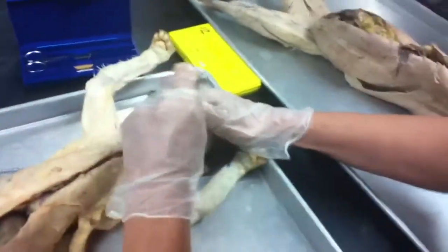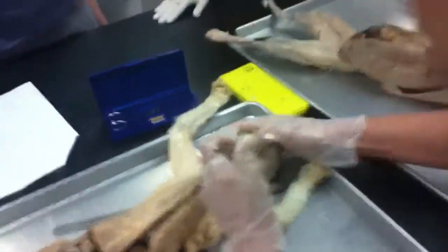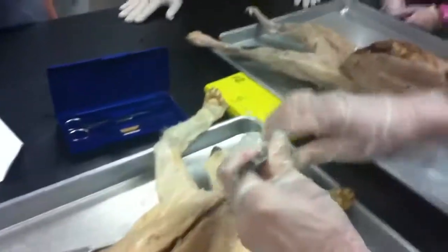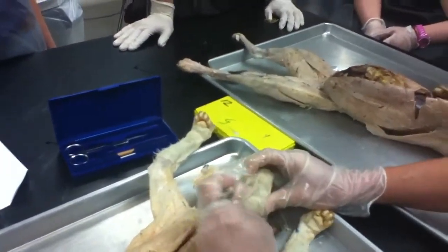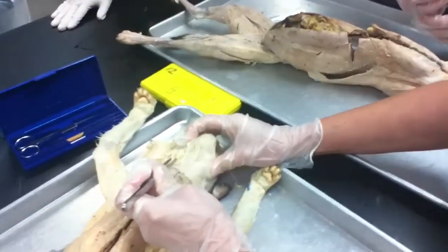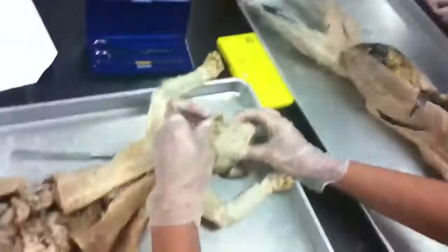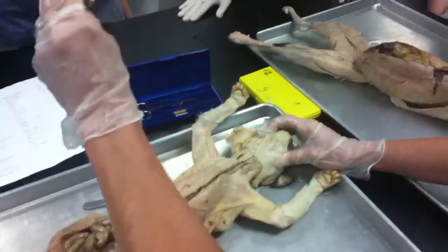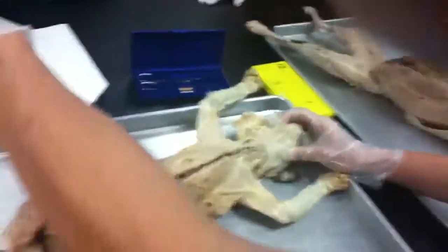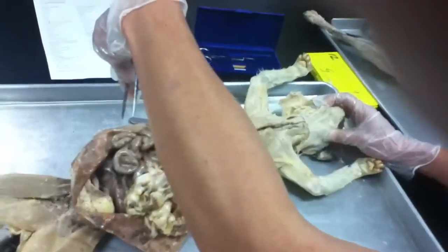Here's your main jugulars that are coming up into the cat's head and things. You actually have 2 what are called the sublingual glands. And where are they located? Under the what? The tongue. Lingual is tongue. Good. So there's actually 2. They look like little beans that are sticking out right there. Okay? So parotid, submandibular, 2 sublinguals. All right? That should be everything on that left-hand column of y'all's list. Make sure before you clean up today, you know every single thing on that list. Okay?